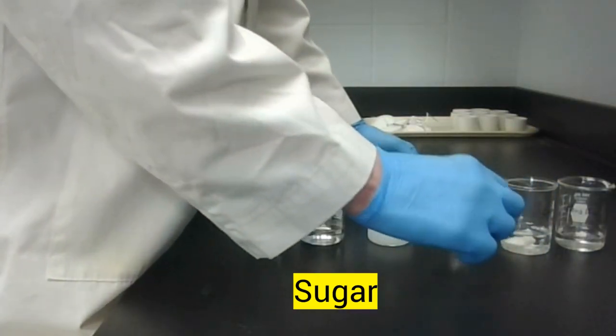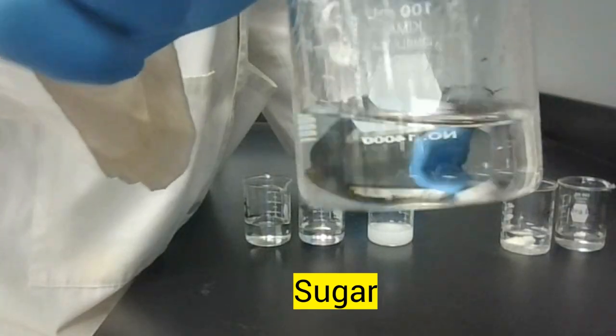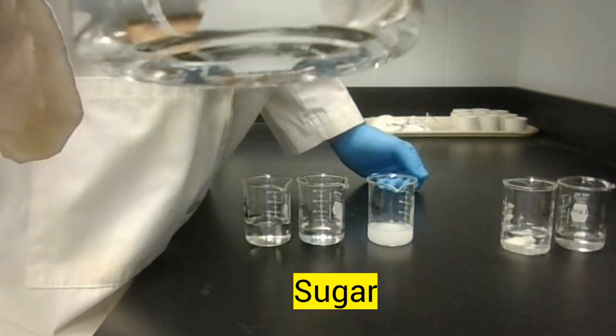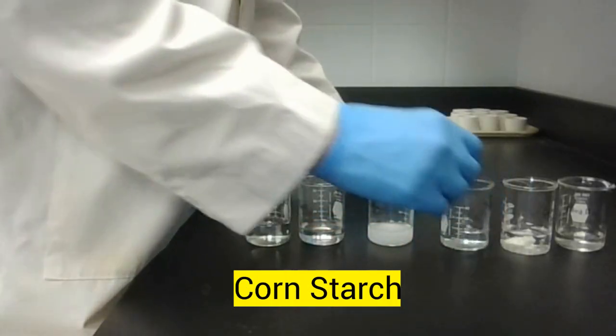Next up, we have our sugar. Now, our sugar did dissolve. You can see the solution is clear. There's no sugar there at the bottom. Let's see if I can get it on screen there without spilling it. No sugar left. It's dissolved in that water. We'd say that sugar is soluble.